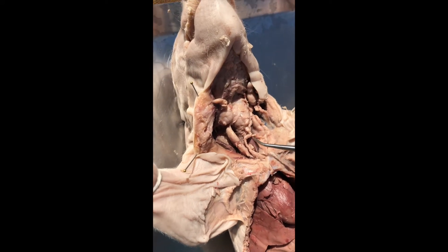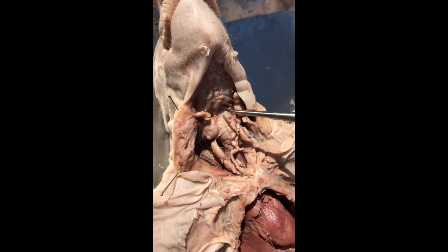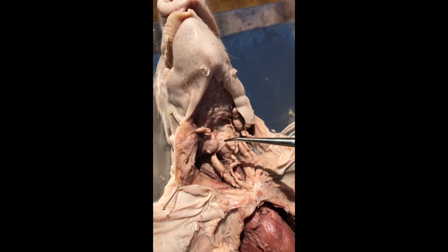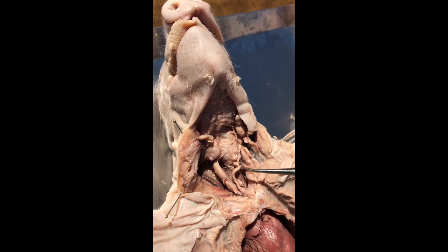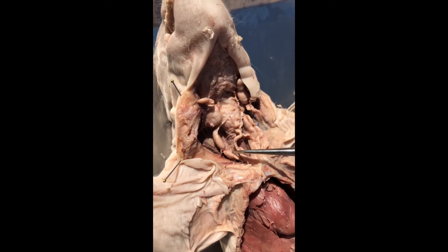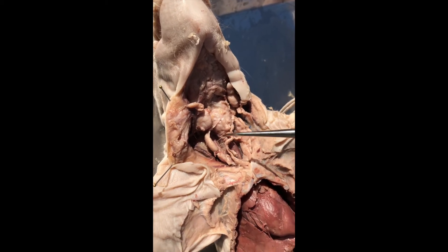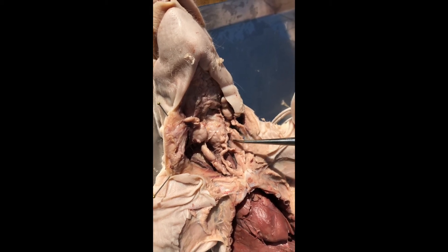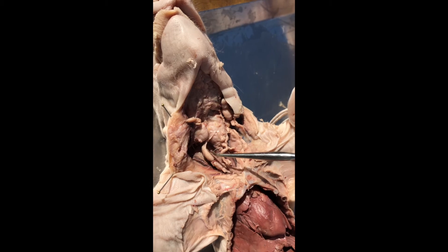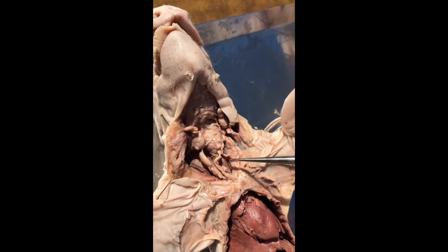Now going back to the pig with a partially dissected neck, we have some structure here with a lot of tissue on top of it — this is going to be the larynx, we'll talk about that in a bit — and then some swallowing muscles. But lateral to those swallowing muscles, we have some more gland; this is thymus. Back when we were talking about the thymus over the heart in the pericardium, there would be more thymus in the neck. This is where the T cells, the generals of the immune system, are formed and trained, and there's lots of thymus in fetuses, infants, and young children.